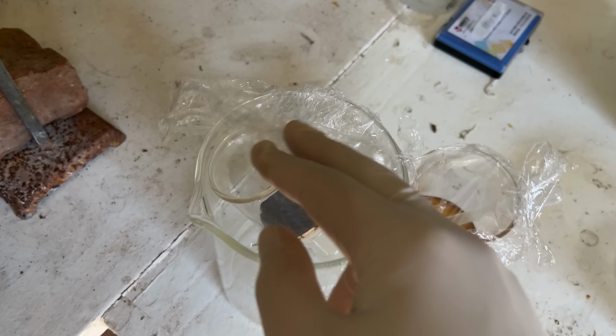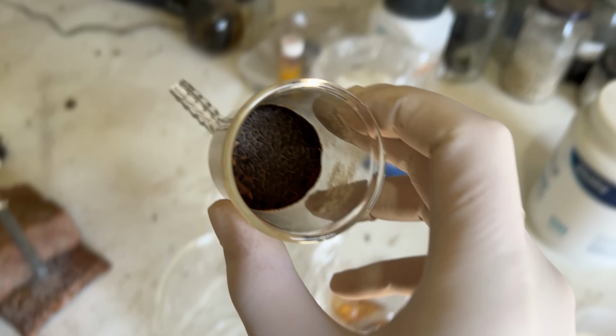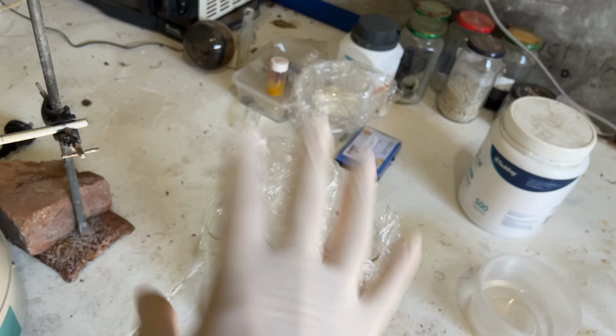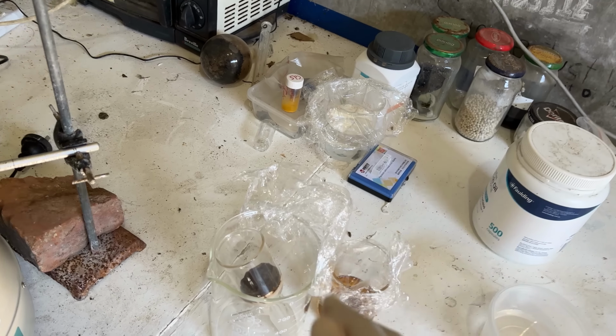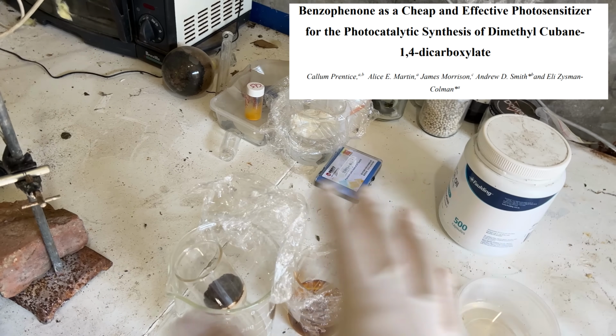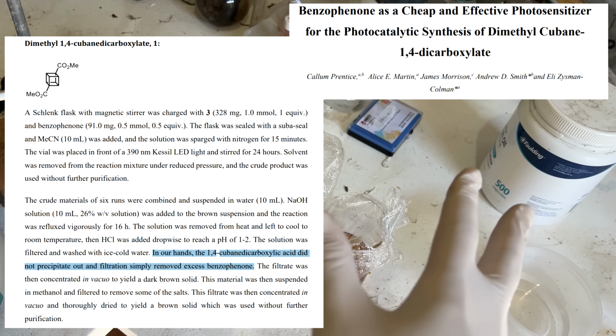All right, and here is our magical tar that we got very excited about because we thought it was the cubane. And we've run the NMR analysis. You can see where I've taken the sample out from there. So that's bad, obviously, but all is not lost because if we read one of the references that we're following, the reference that we were meant to be following nearly completely, exactly, we notice that they also say the cubane doesn't precipitate out. They sort of mention that it's pretty weird.